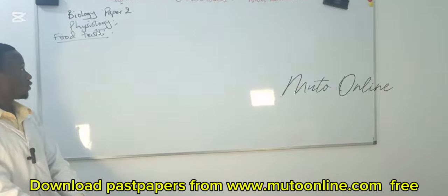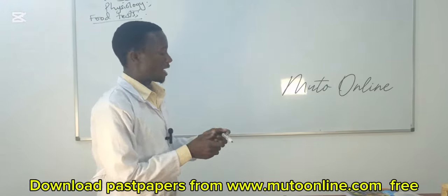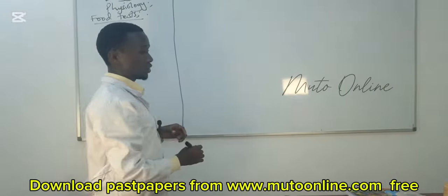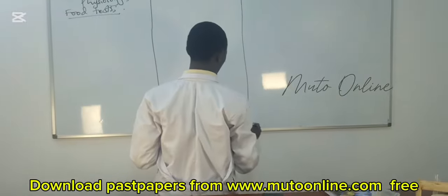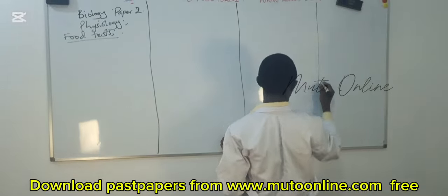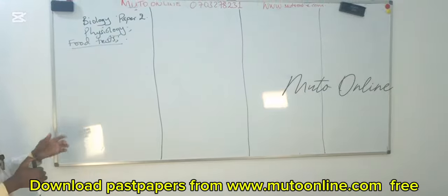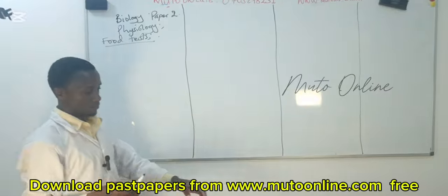Today's practical is going to be brief because we've been doing a number of them, and I know we have enough concept and information about these practicals that we can use to actually do them.